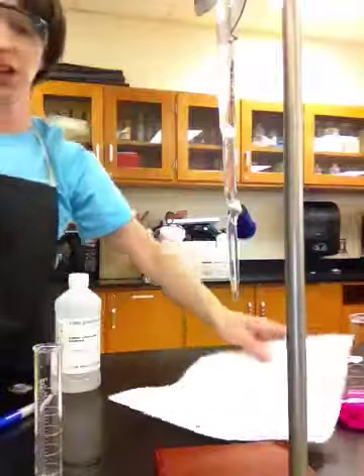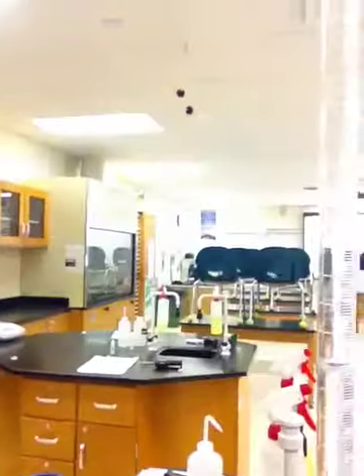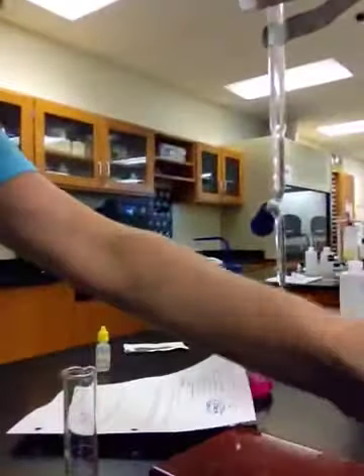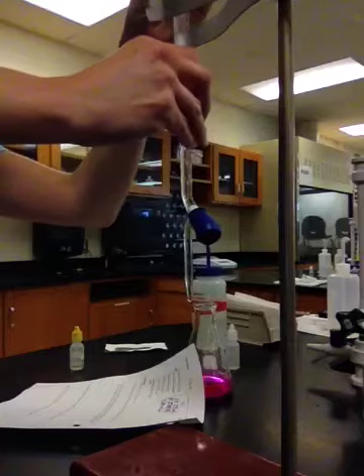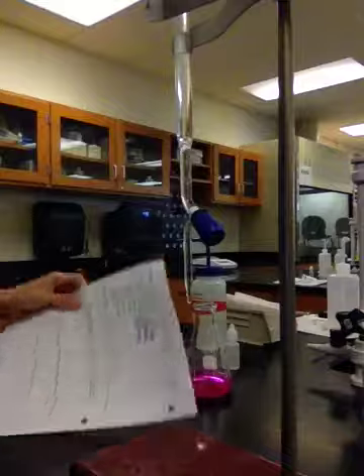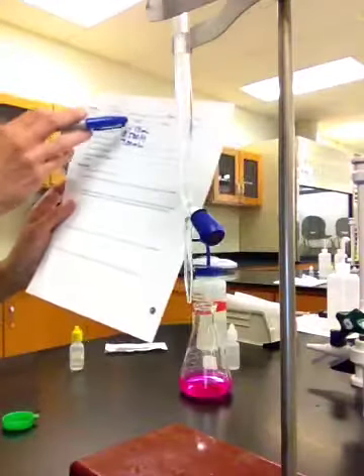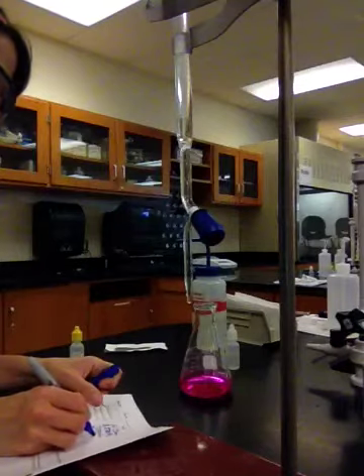Okay, the final burette reading, okay? Take this guy and move it. I know you guys are getting seasick right now. Let's see if I can find it. You guys can see where the level is. Of course, you can't read it. Okay, it's jiggly, but I will read it for you. It's coming in at about, you guys can write down 31.40. Okay, so again, on your lab, this would be the 4th data entry, 31.40 milliliters.